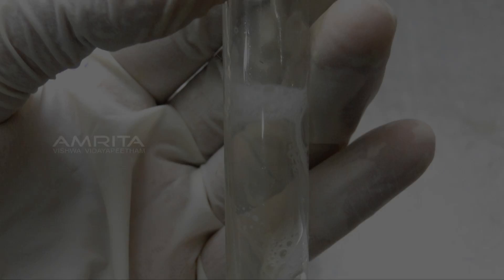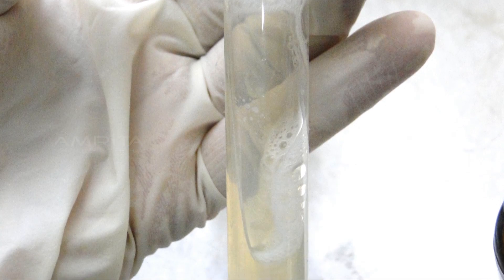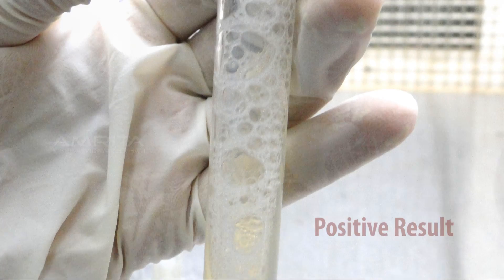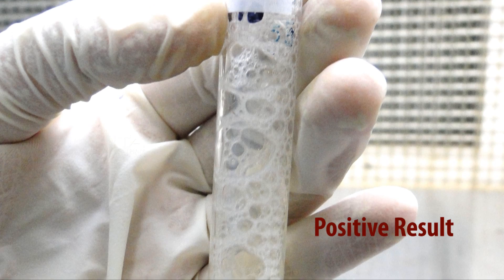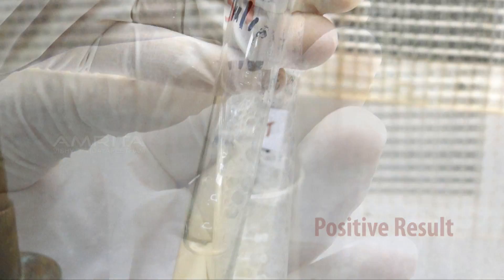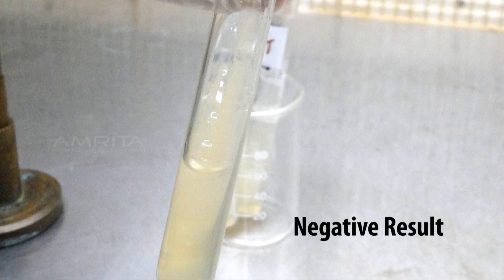Result. After addition of hydrogen peroxide on the slant culture, presence of bubble formation is a positive result. Absence of bubble formation is a negative result.